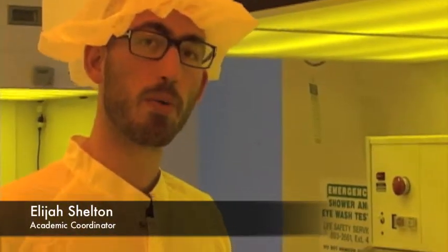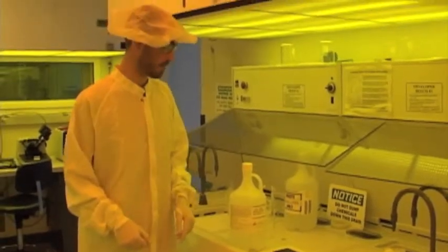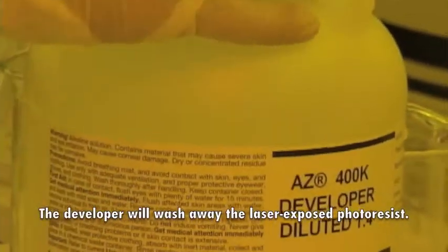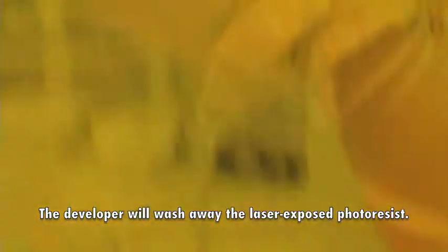Right now we're in a different clean room, and this is the clean room where we're going to develop the mask that we prepared using the mask writer. This is a corrosive material, it's a base, that we're using to remove the photoresist that we exposed using the laser. I'm going to pour it in this beaker.